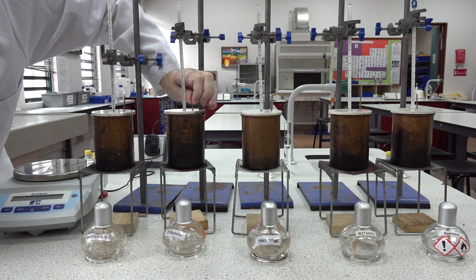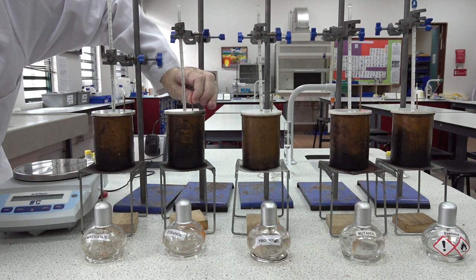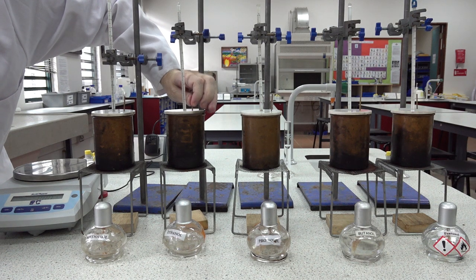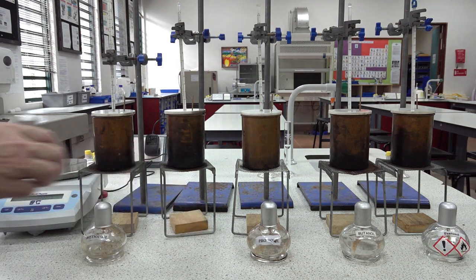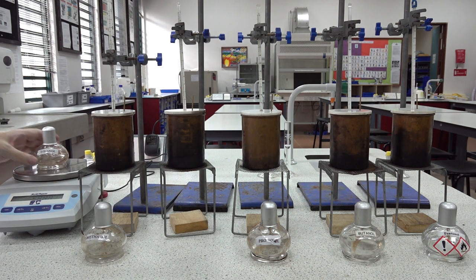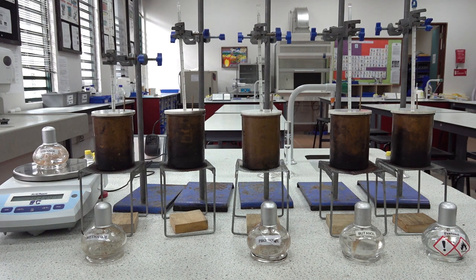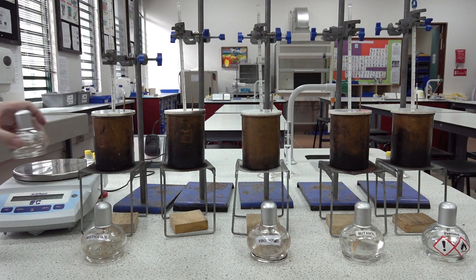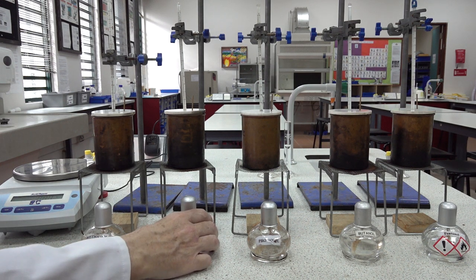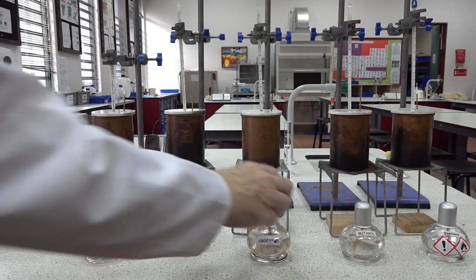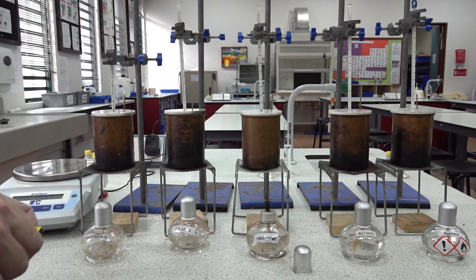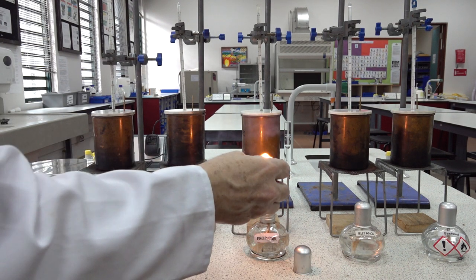We now need to re-weigh the ethanol spirit burner, and it now reads 193.34 grams, and the temperature is still 35.5. Let's start the second experiment. This is for propanol.